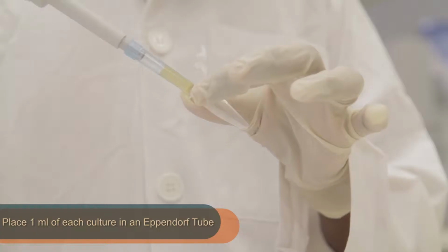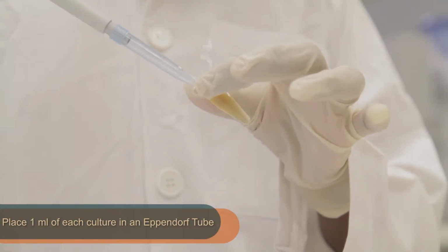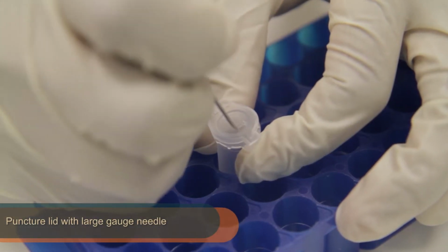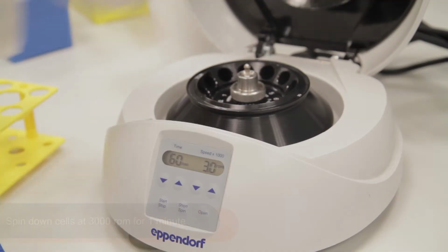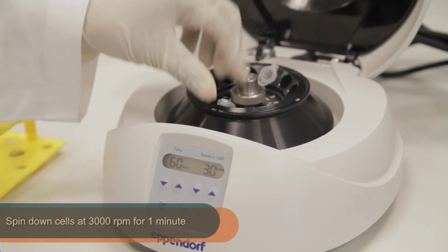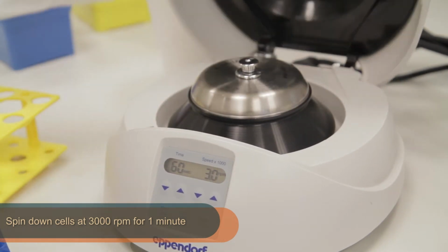Firstly, place 1 ml of each yeast culture in an Eppendorf tube. Next, puncture the lid of a tube with a large gauge needle several times carefully. The TAs will be helping you with this step. Then, spin down the cells at 3000 RPM for a minute. Make sure the centrifuge is balanced before proceeding.